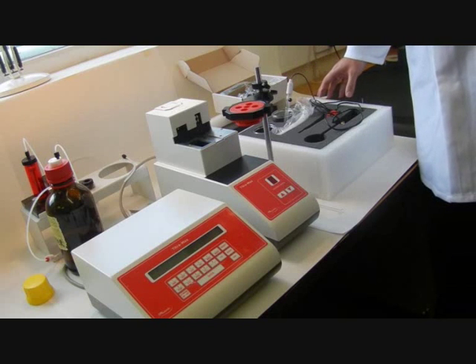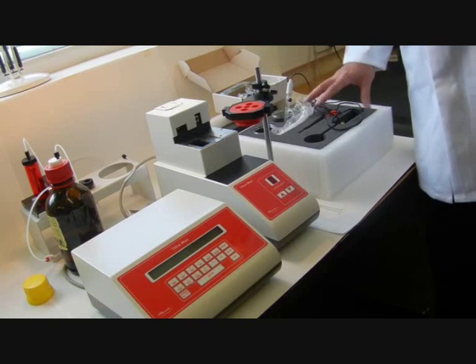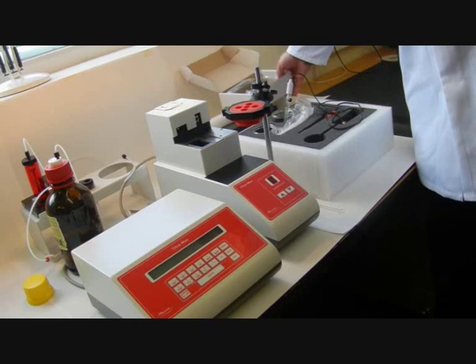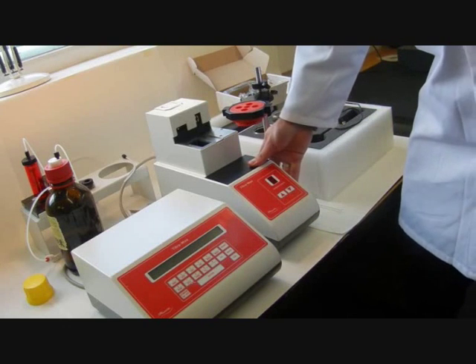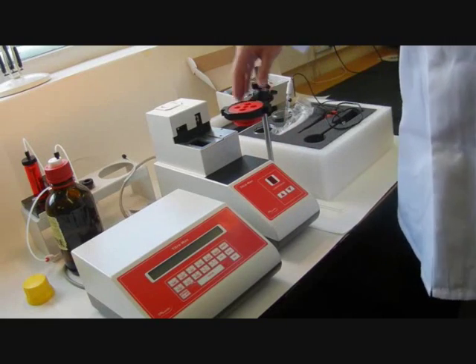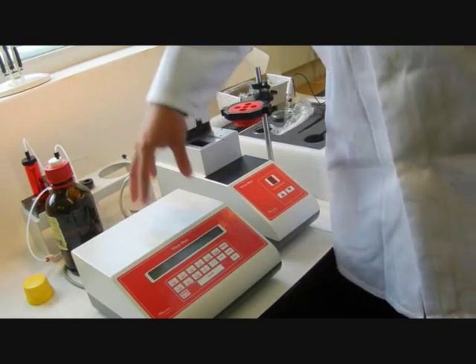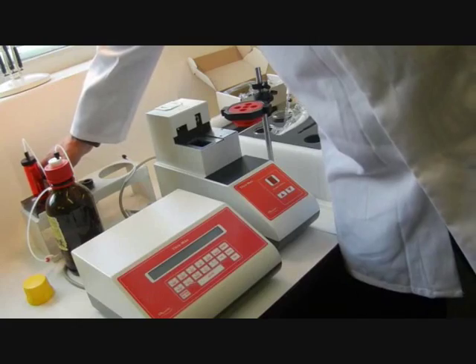Lay out all the component parts from the Titramax on the bench. Check that everything is in place and should have an accessories pack, power leads and cables, the titrator base, the titrator head, the control unit and the burette unit.